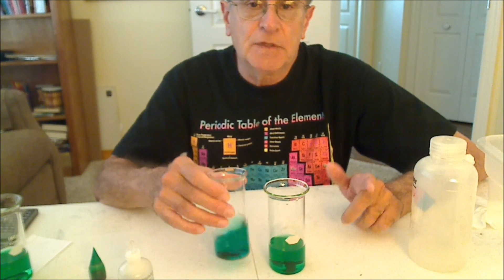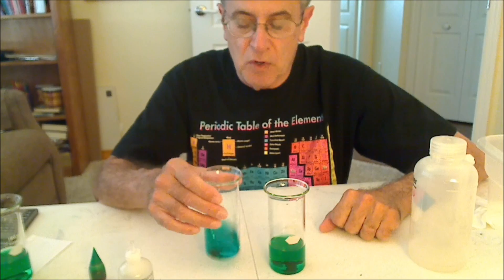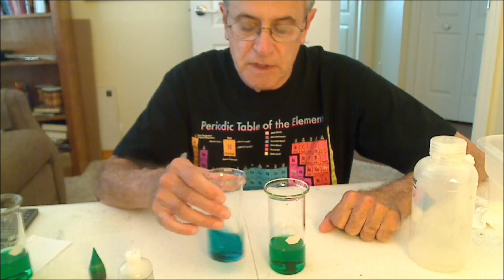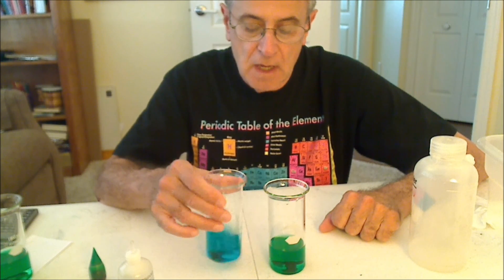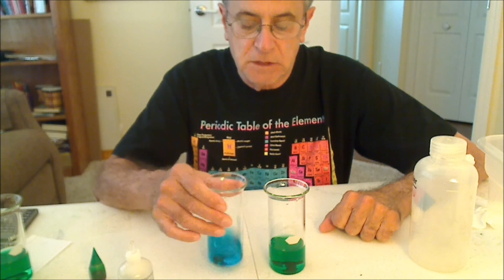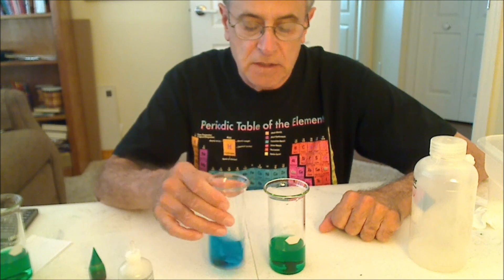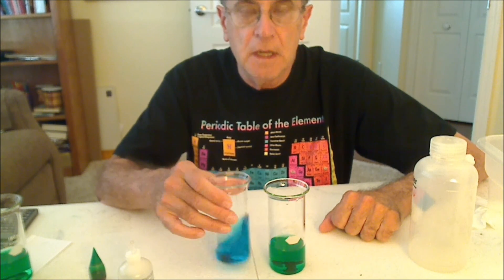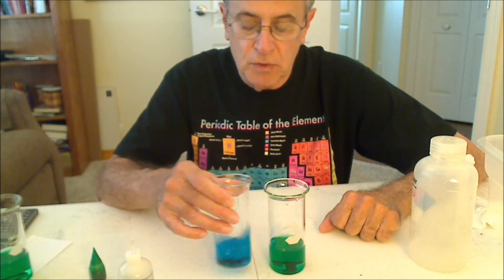So we're making an observation. That's part of the scientific method — making observations. I think you can see that the color is changing, and it's changed from green to blue.